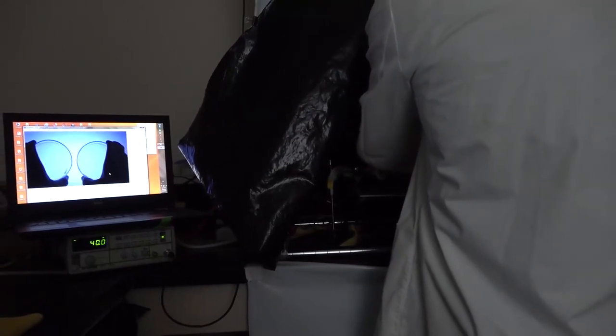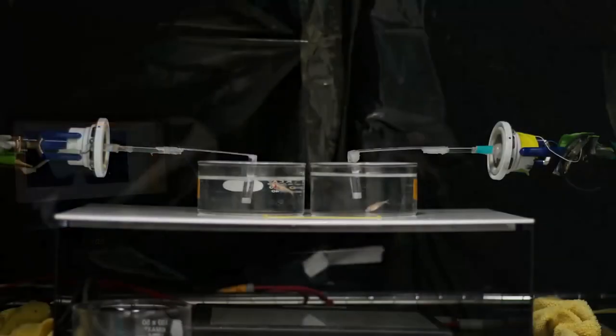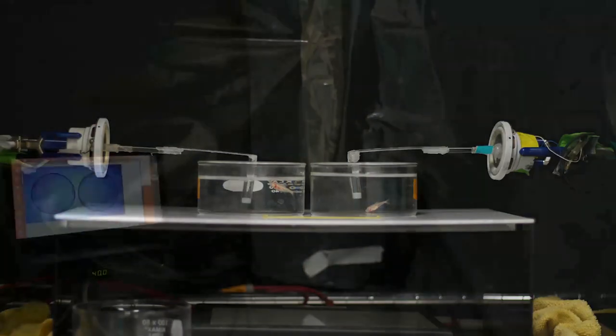Place assay cylinder on the recording stage illuminated with infrared backlight in a dark room and allow fish to acclimate for three minutes after being placed on the stage.